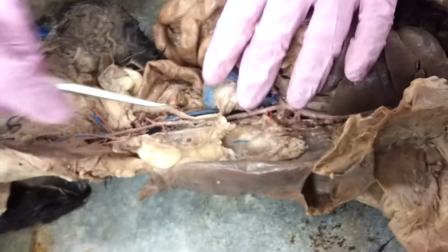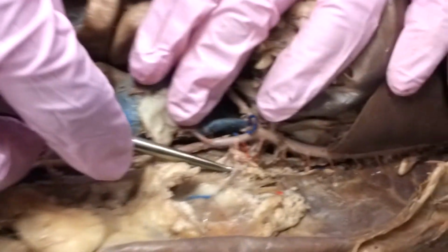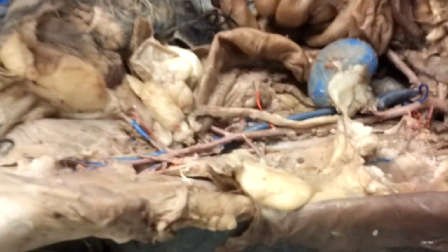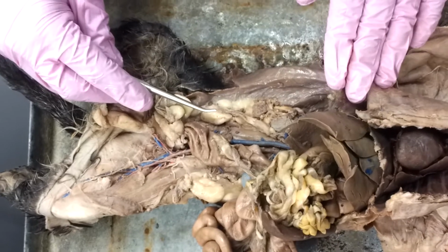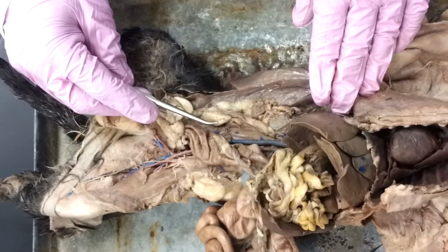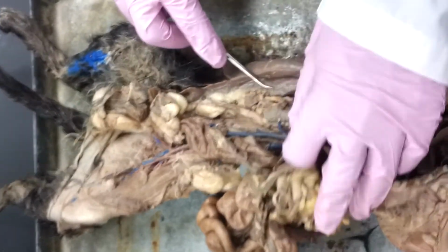The only other thing I want to mention is, we talked about the adrenolumbar arteries and veins. They run together. They're going to be going right to that nodule. We talked about the iliolumbar. The only thing we can't see, because this cat's not triple injected, is the hepatic portal system. So we'll get out the triple injected cat one day and look at the hepatic portal vein, gastrosplenic, superior and inferior mesenteric.